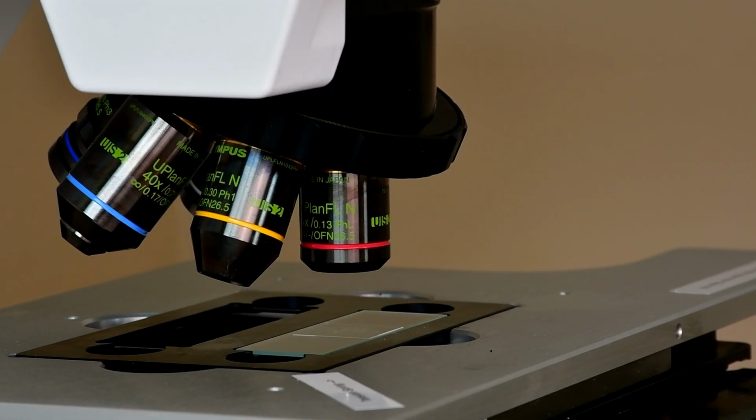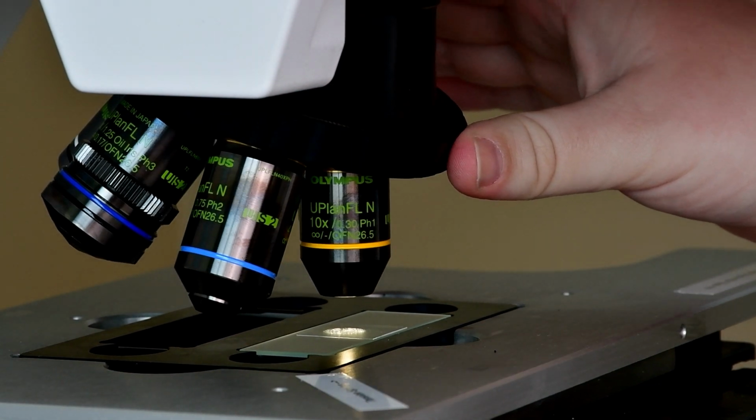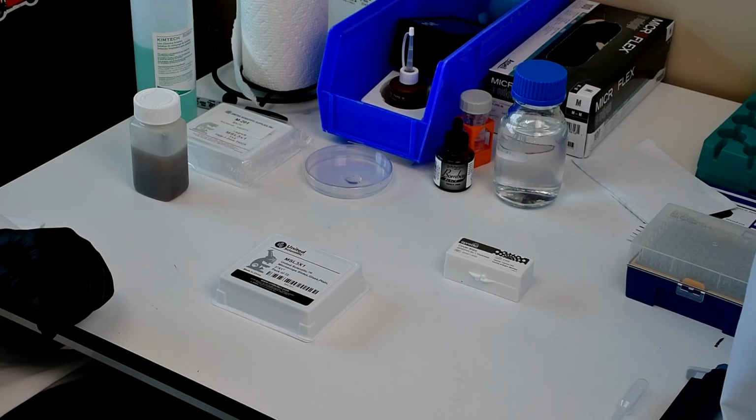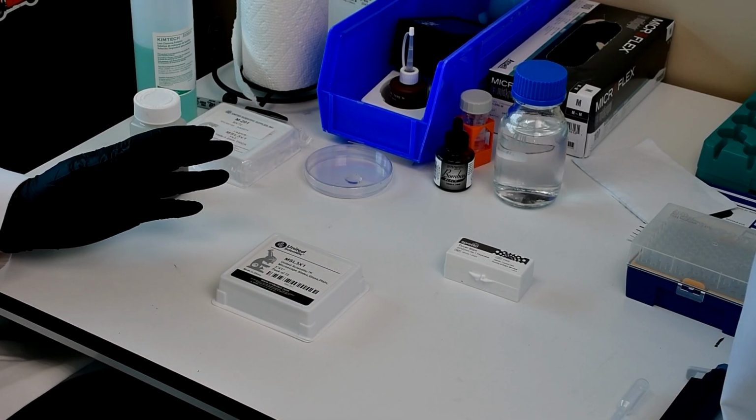The main focus of this webinar is going to be on filament identification, but this can be a strong resource to use to remember how to prepare a slide or learn how to prepare a microscopy slide for wastewater routine analysis. Preparing your slide for microscopy is very straightforward.